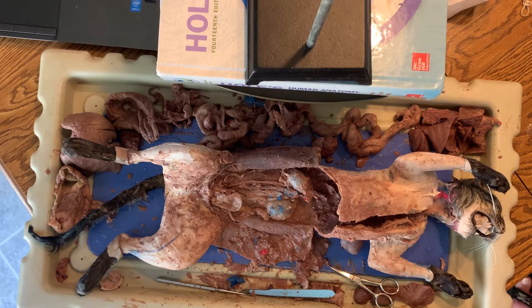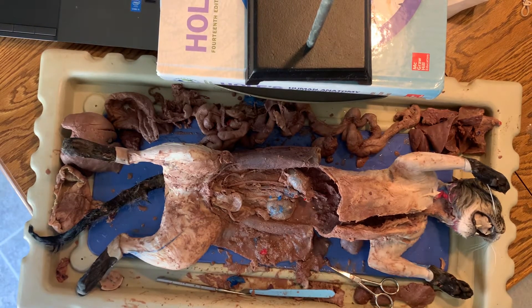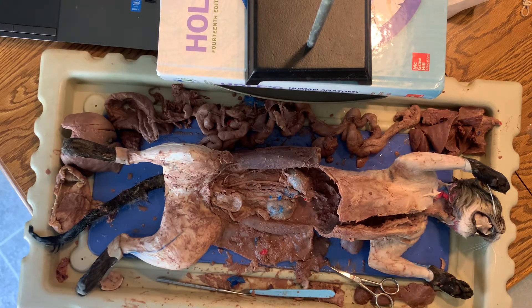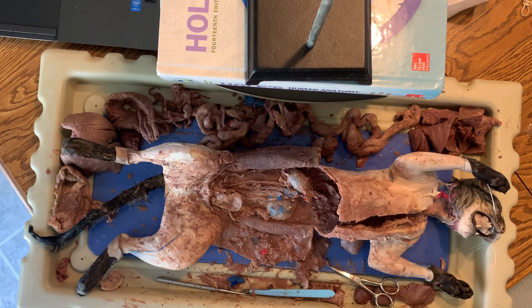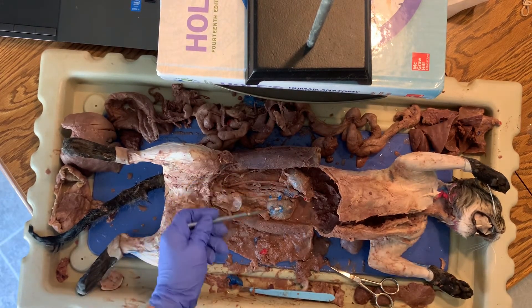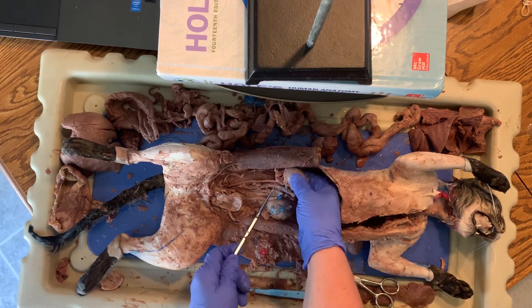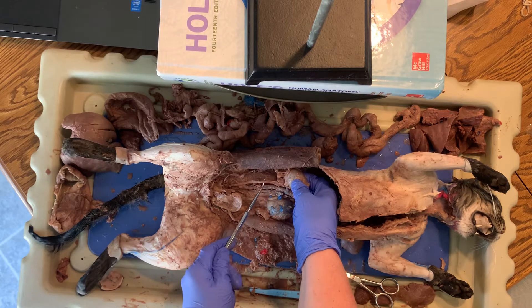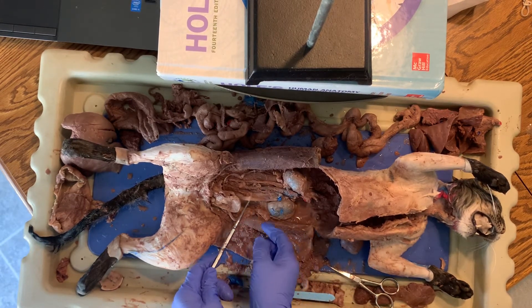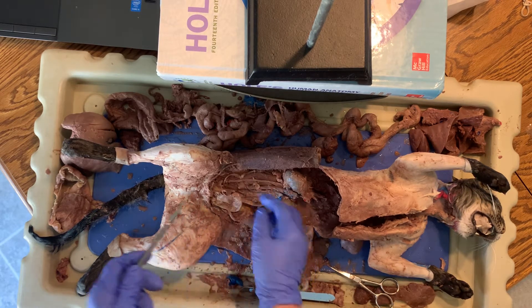Hi again everybody, Miss Westeroff here for your final video of the cat dissection — this time urinary and reproductive. The urinary system is pretty simple. We've got two kidneys: here is the cat's right kidney and left kidney. Coming from the kidneys is a tube called the ureter — this tube right here and this tube right here — so we have left ureter and right ureter.